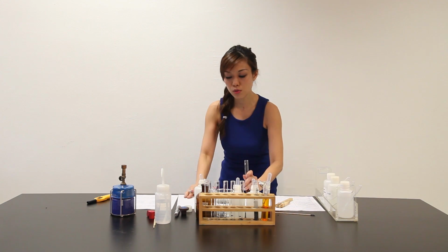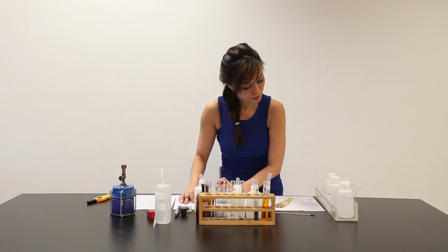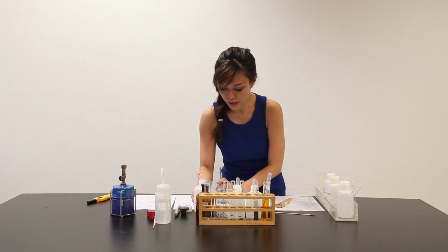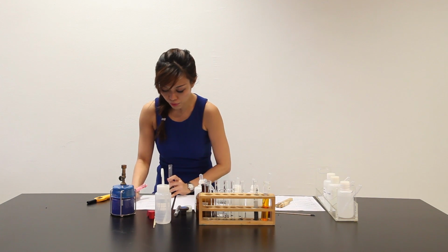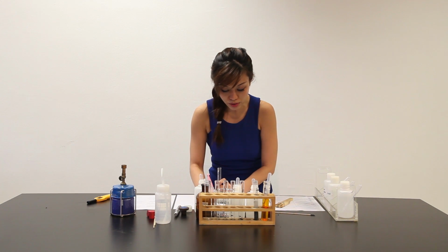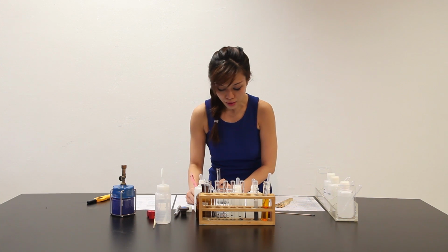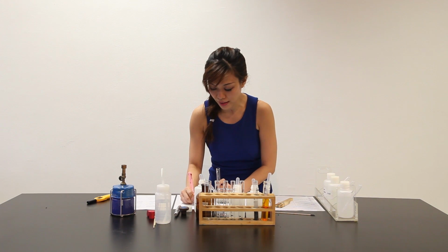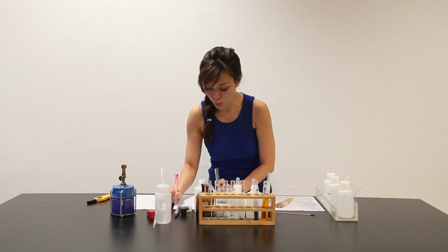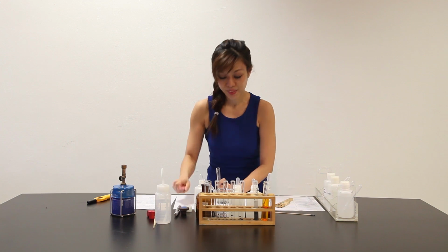I can come to a conclusion. Conclusion 1. Salt X contains, according to the QA note, reddish brown PPT is Fe3+. Fe3+. Evidence 1 in part C. Part 1, when NaOH is added, solution gives a reddish brown PPT. Let's move on.